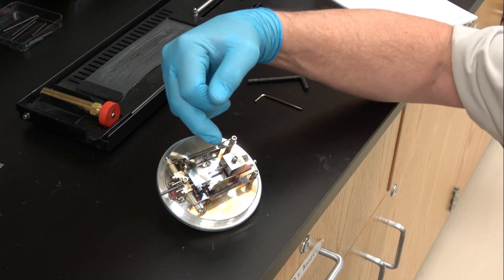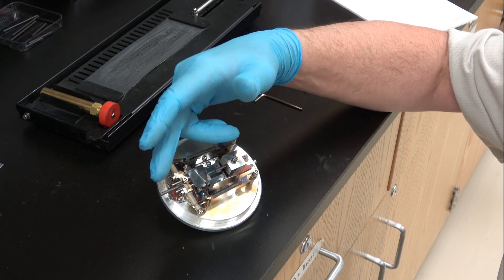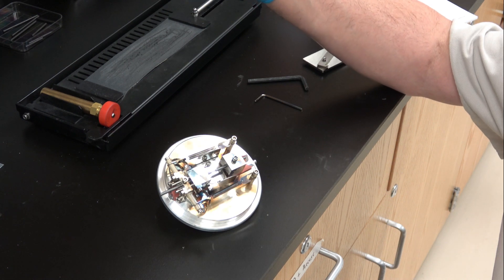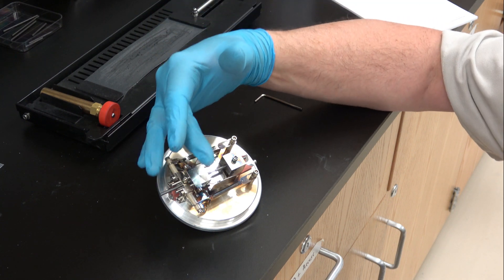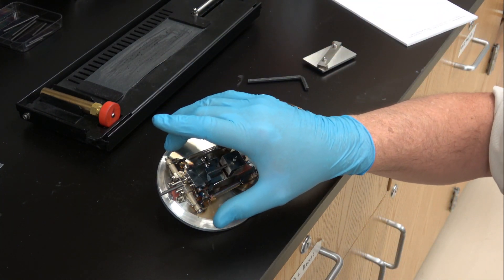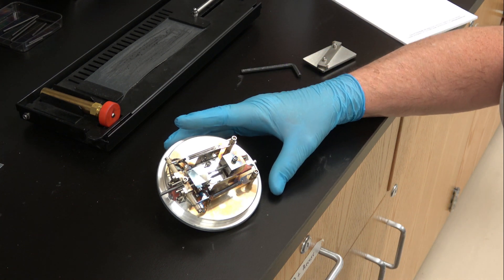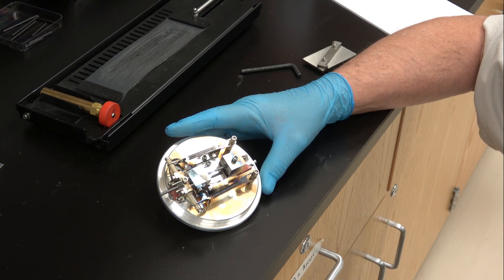This is spring loaded. As your carbon burns where they touch, you have an electrical circuit — you pass high current through the rod and it burns under vacuum, sublimating carbon off onto your sample. You want some ability to feed the carbon as it's being evaporated, and that's what this spring-loaded system does. I set a five millimeter backset because that's about the maximum. Now we're ready to go back to the machine and set up a carbon rod pulse profile.